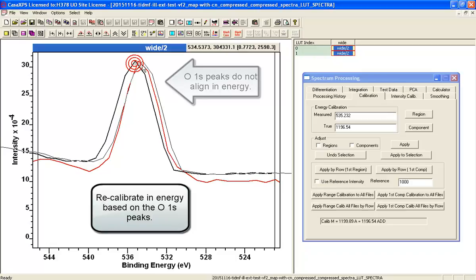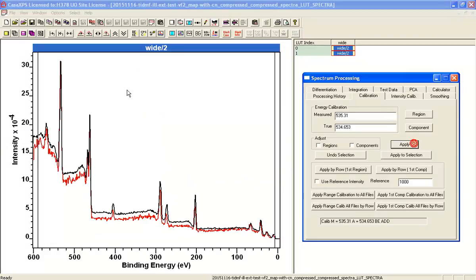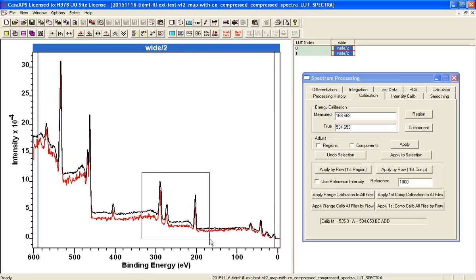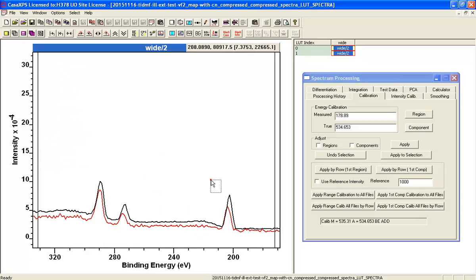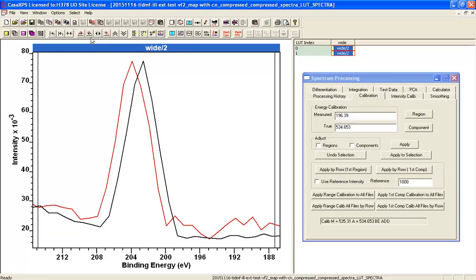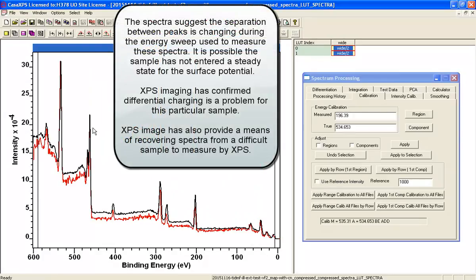Let's do the same thing again and shift the oxygen peak so that it looks like it's calibrated. We can see that the oxygen and the titanium look reasonably well aligned, but we now have a misalignment up here. So not only do we have a different charge state, we have potentially got a sample here where one part of the sample is continuing to charge differentially over the length of the experiment.